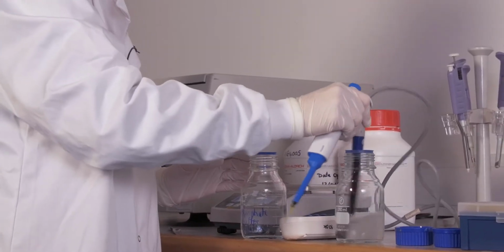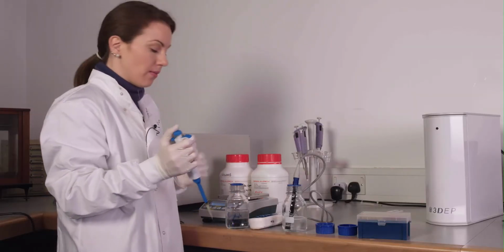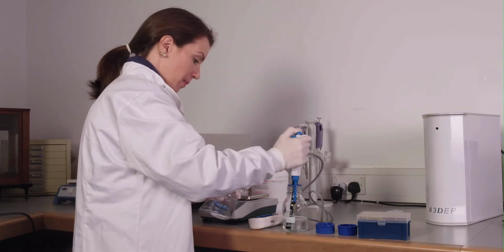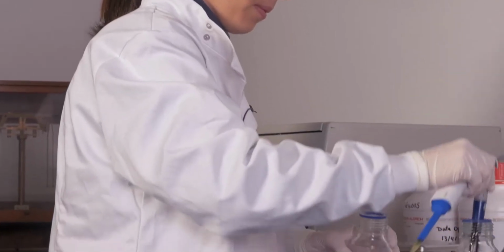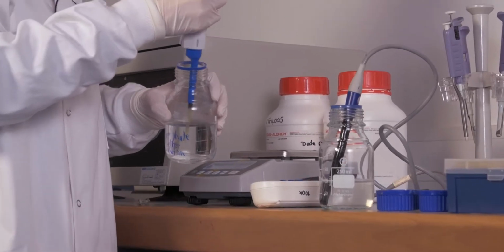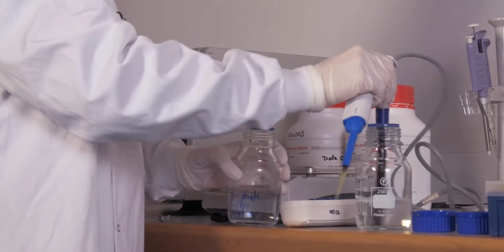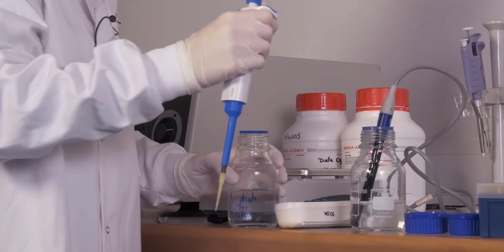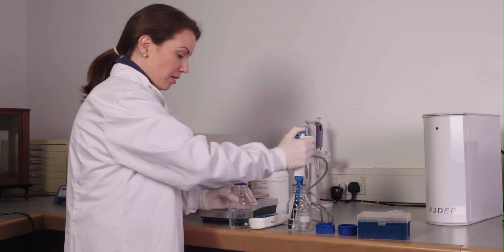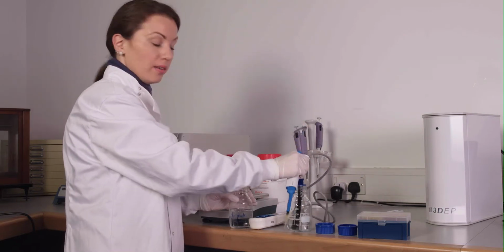And you'll just mix it up and remeasure. So even with this small amount, we went from 6 to 27 microsiemens. While this is a slow process, it's better to do it in small steps of the PBS than to do it too high steps and end up going past the conductivity that you need.